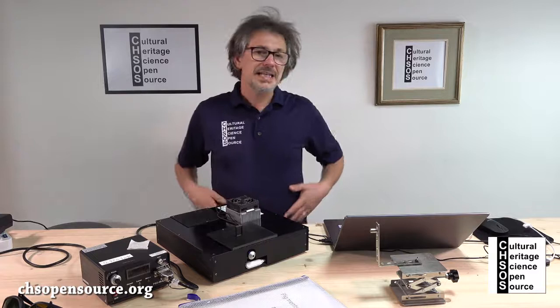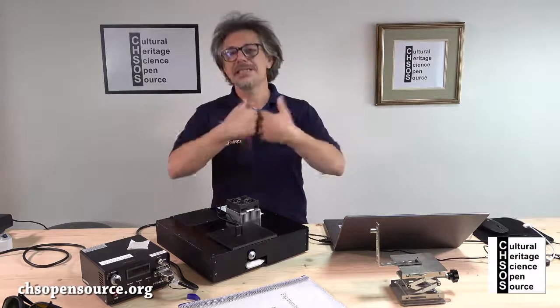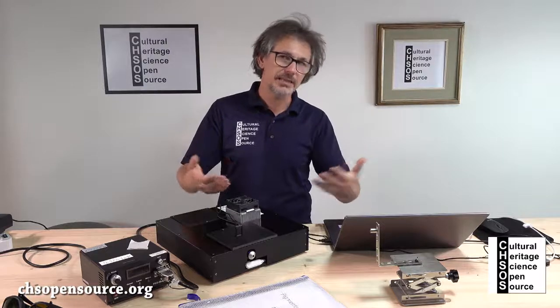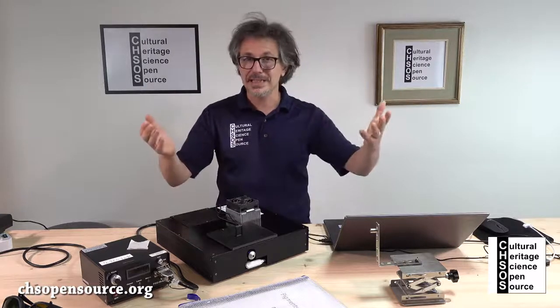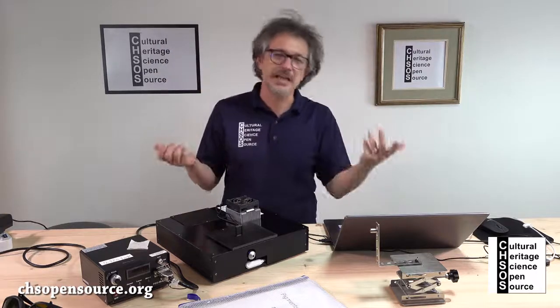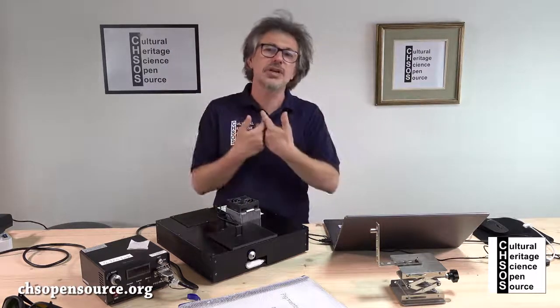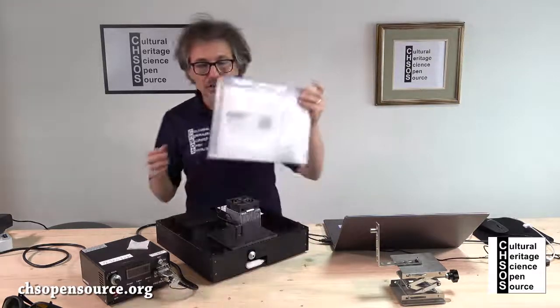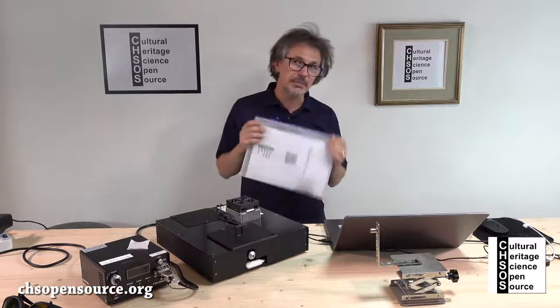So in this case, basically we have a lot of signal because the pigment is fluorescent itself. So if we close the slit to the maximum, it doesn't make any difference. Still, we're going to have plenty of signal. Okay, so let's go directly to do the experiment.